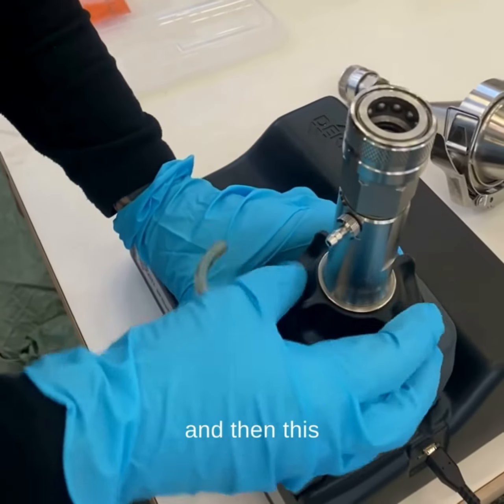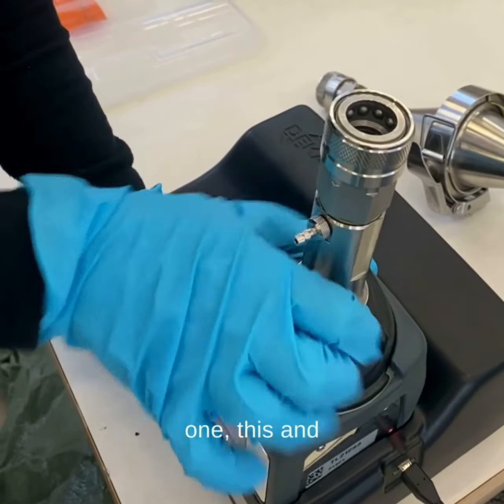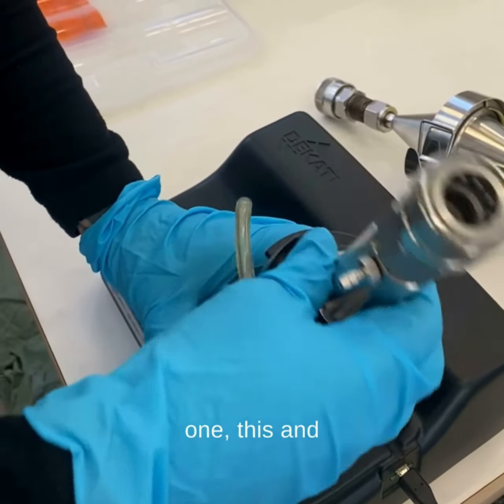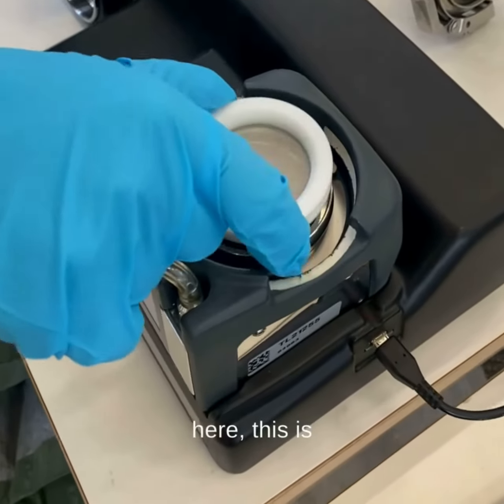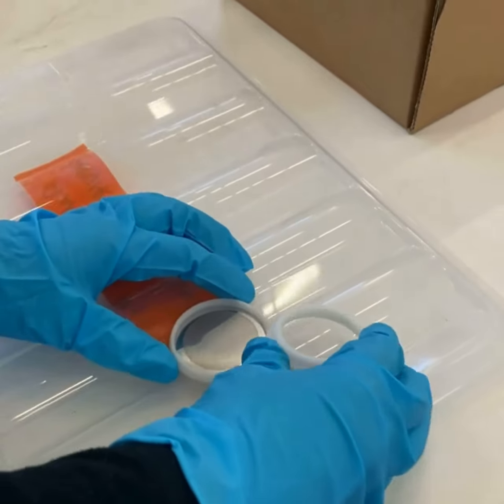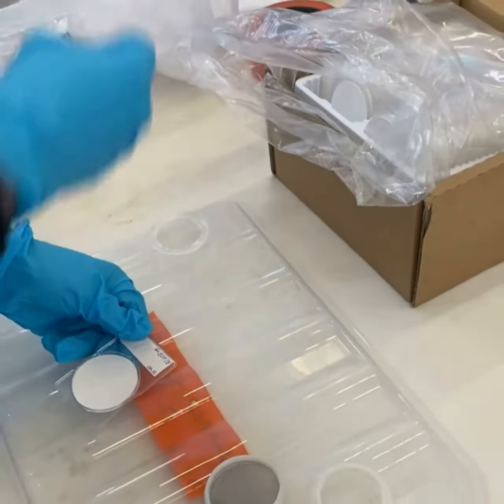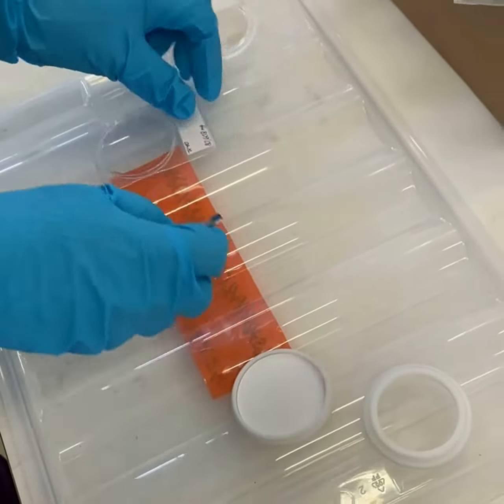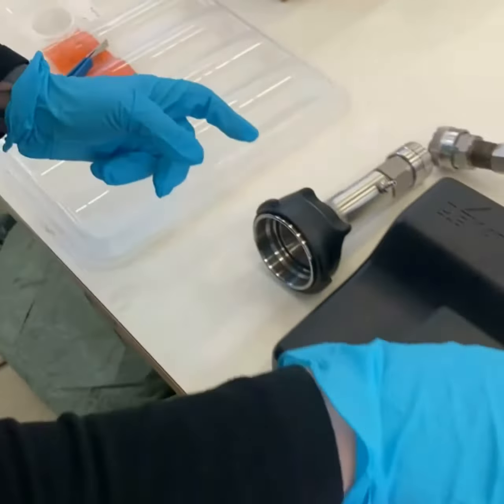And then this one, and this — here, this is where we put the filter in. Let me just close back a minute.